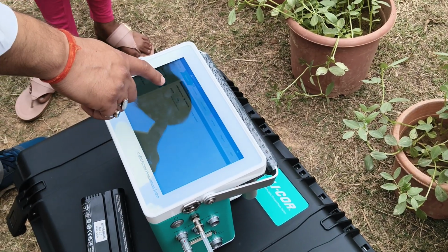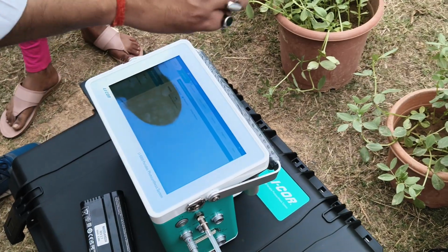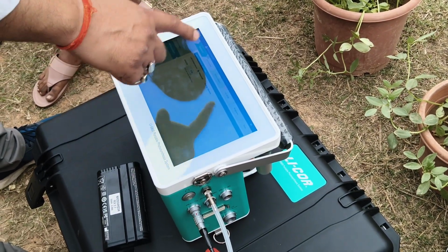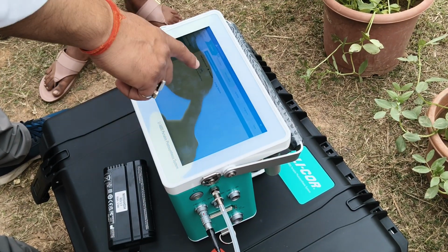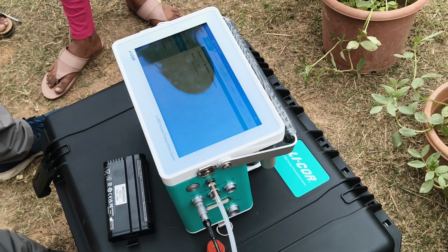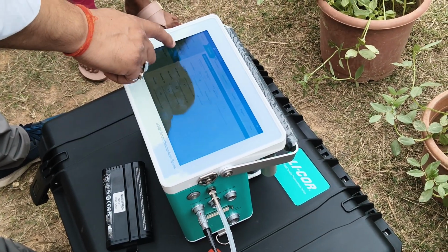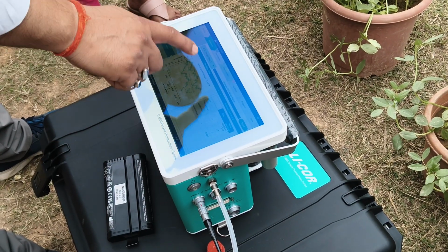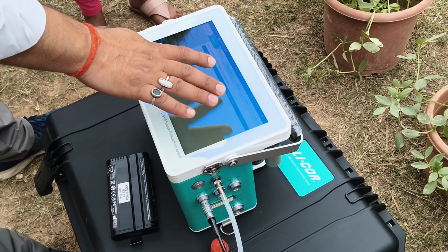Here there is a leaf temperature option. There are 2 types of temperature sensor: one is a thermocouple and one is a thermistor. When measuring with the help of a thermocouple, the fine-wire thermocouple, use the measured option. If there is some chance it can be damaged, go to energy balance, thermistor balance. These are things we cannot change. There is a range match, just check and verify. Nothing you can do in user.